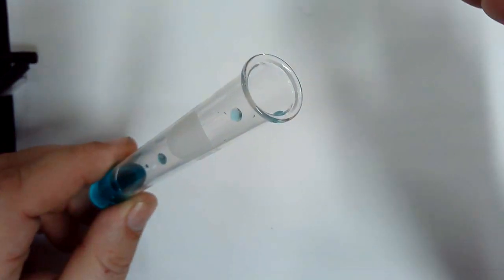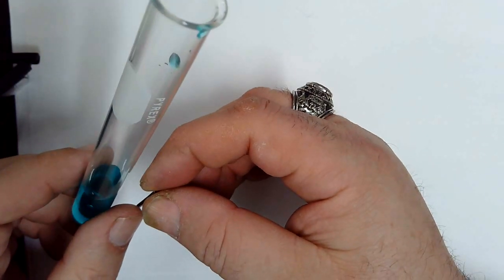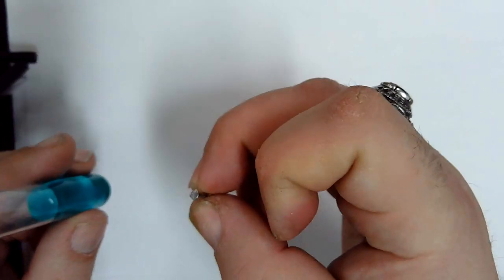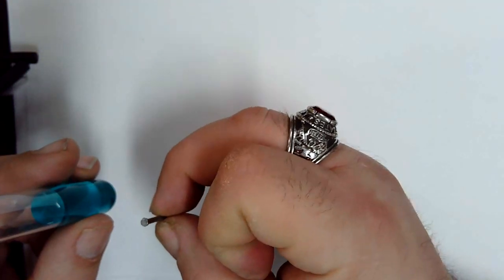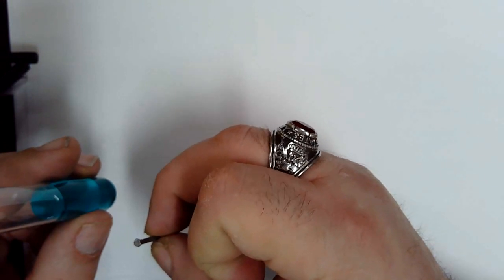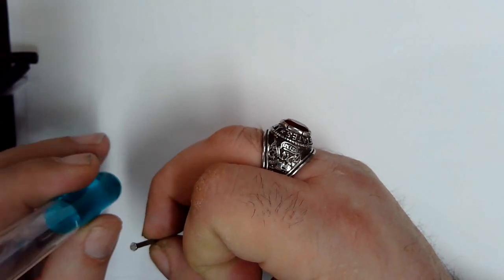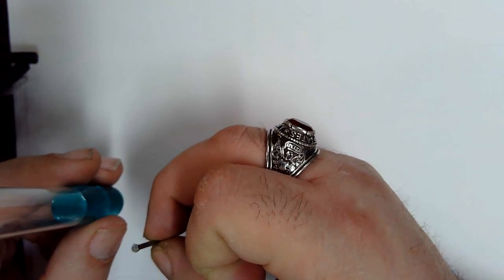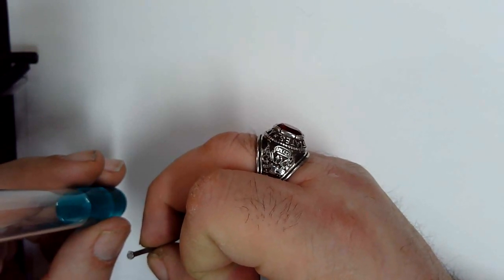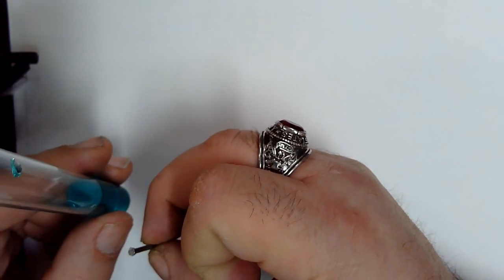Why do I want the nail to be completely submerged? What is completely covered if it's completely submerged? The nail is completely covered. So what? The copper chloride. Yeah. Where do all reactions occur? The whole nail. Okay.